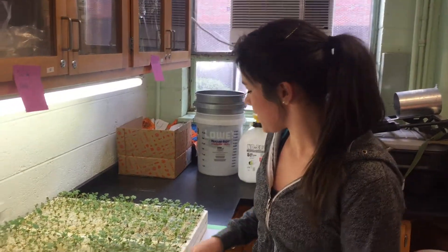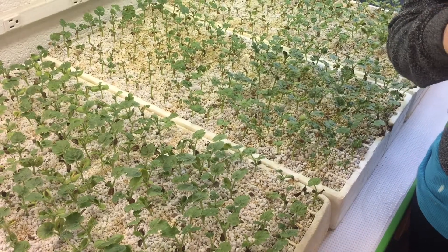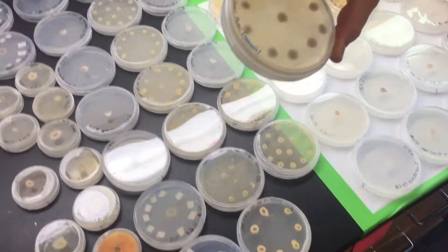Now that you have some background on Fusarium wilts, we are going to move into the lab where I can show you how to work with Fusarium cultures so that we can prepare an inoculum for greenhouse studies. For demonstration purposes, I will be using the pathogen Fusarium oxysporum forma specialis niveum. Once we receive an infected seedling, you can see symptoms like yellow chlorosis of the cotyledon leaves or maybe a little wilting. We remove all the soil, and also remove any other pathogens that might be living on the plant roots or vascular tissue outside of the plant by dipping it in a 5% bleach solution and then distilled water. Then we dice the vascular tissue into cross sections and plate those cross sections onto a Fusarium-specific medium and let that grow out. You can see these little white halos that are already developing.